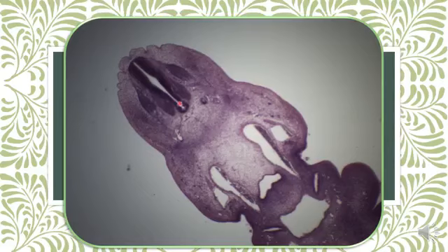More caudally in the same slide, also dorsally, the neural tube. You can see the neuroepithelial, mantle zone, basal mantle zone, and marginal zone. Also you can see these structures called spinal ganglia, or spinal root ganglia.